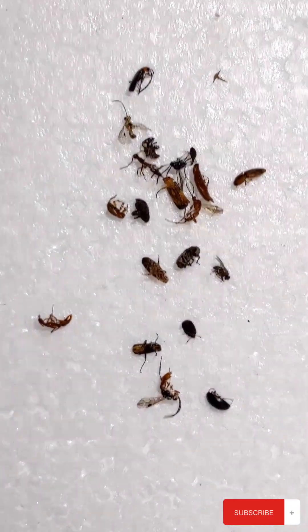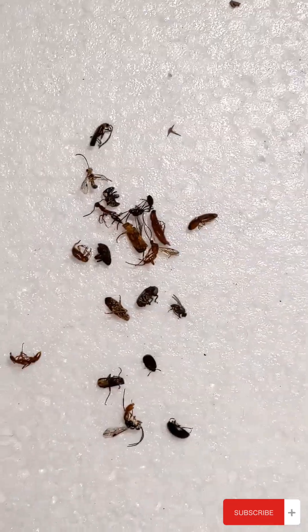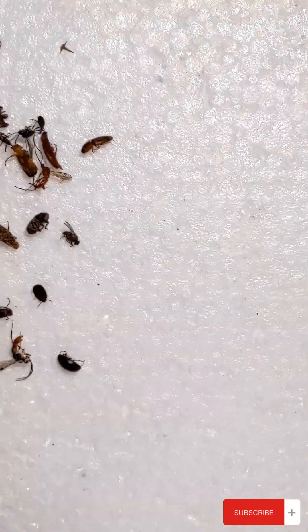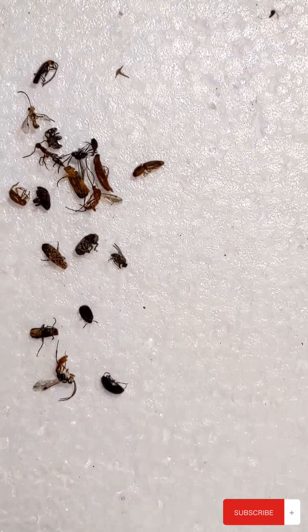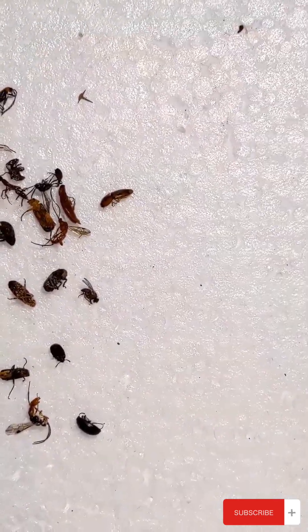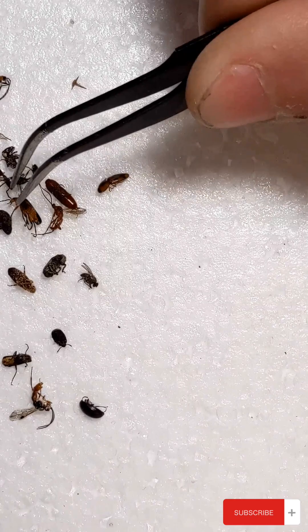Now you select your specimen and I have a few tiny little specimens to choose from here but I'm going to be going for one of these little beetles that I have, probably this little guy right here.